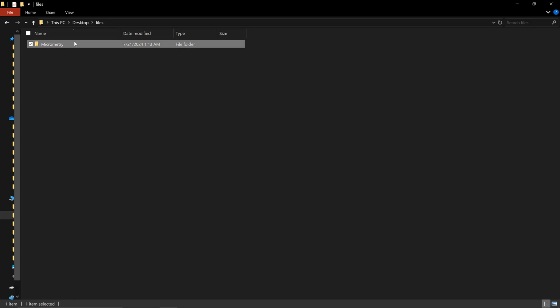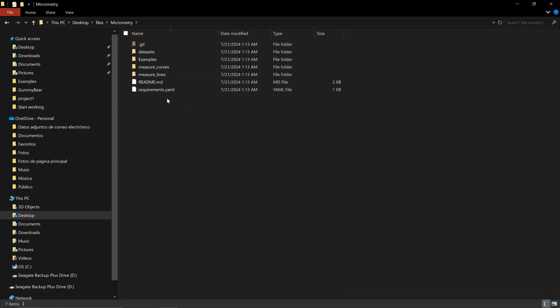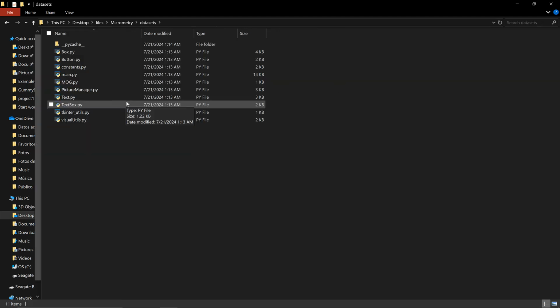Now that we have Micrometry, it's time to use it. The three folders, examples, measure curves, and measure lines, are part of the original tutorial, so I'm not going to go through them. But today I'm going to show you how to install a virtual environment, because I recently created the markdown document for it. So I think it would be also beneficial to show you how to install it from scratch.